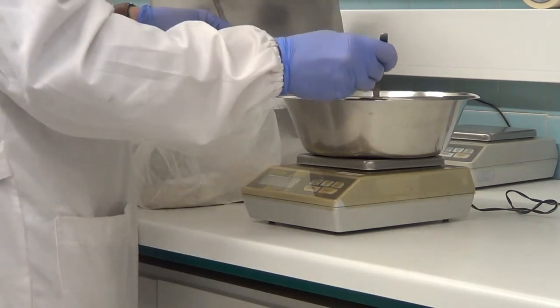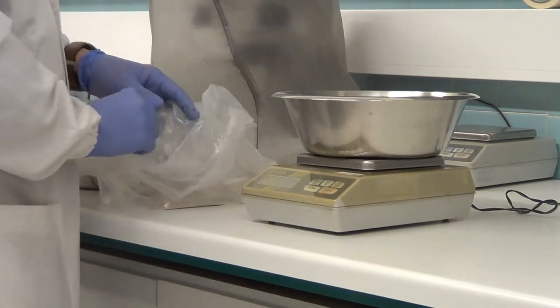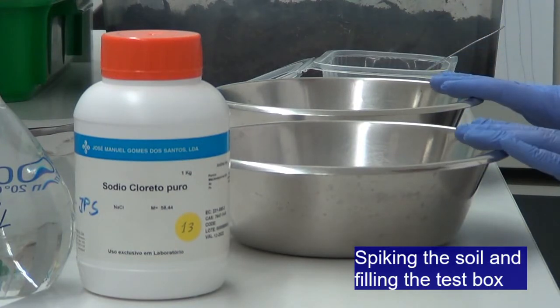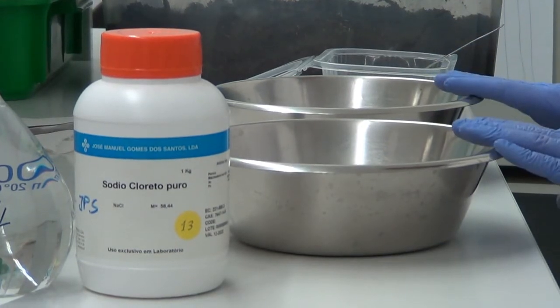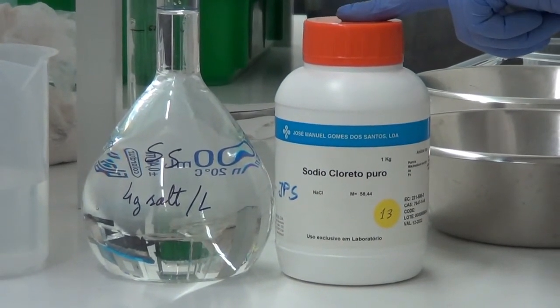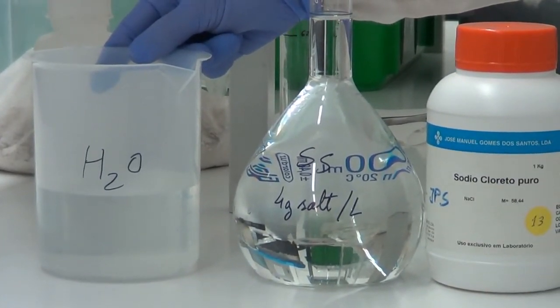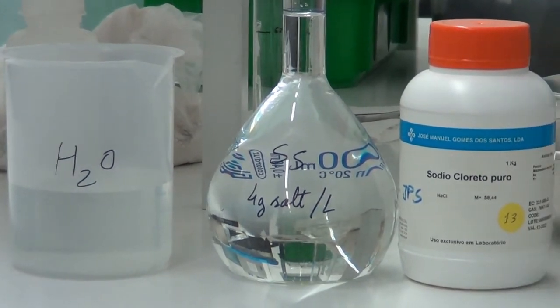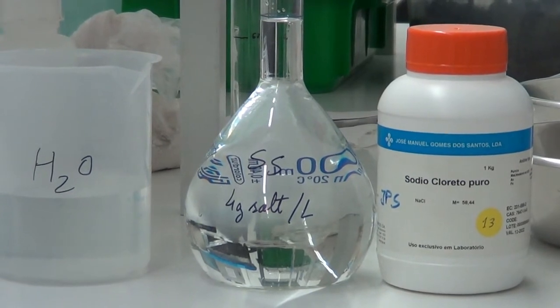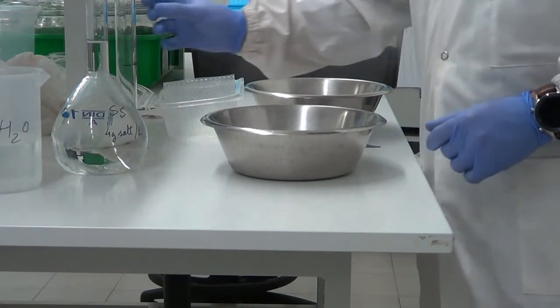Okay. So almost done. 250. Yes. So we already have 2 batches of 250 grams of soil each. We have our stock solution made with salt and water, and we have the distilled water to add in our control. And now we are going to mix our solutions and the water in the different batches of soil to compose our replicate. So let's start with the control.